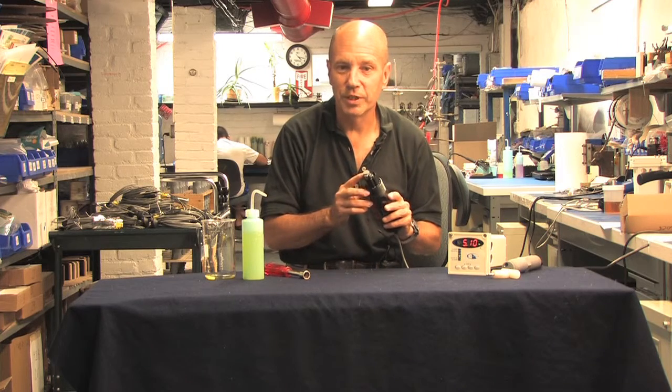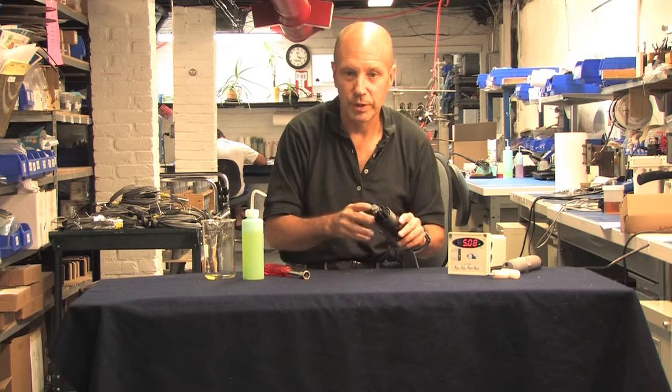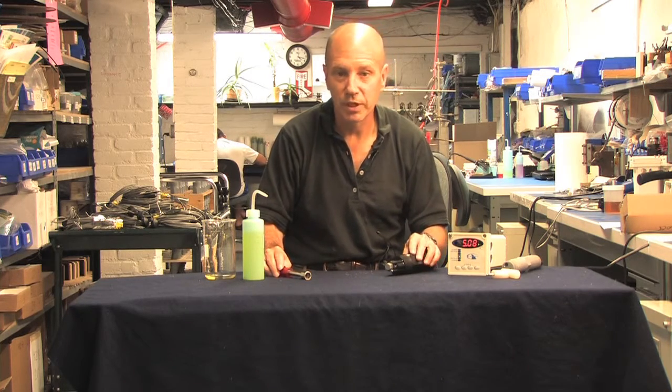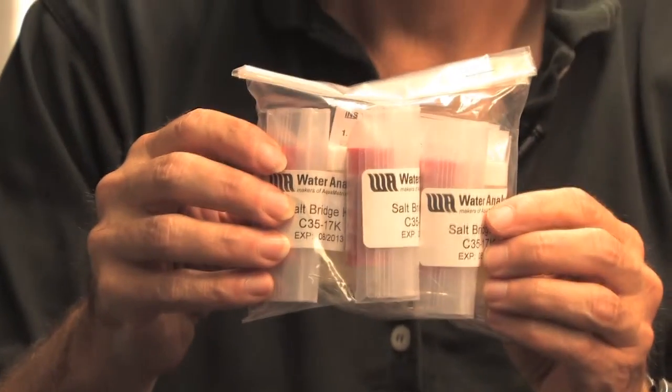Now about that salt bridge, in general, you'll need to replace it 2, maybe 3 times a year. The telltale sign that it needs replacing is that the probe becomes very sluggish. A clogged salt bridge does not affect the efficiency of the probe, only its response. Salt bridges are very inexpensive and come in packages of 3.